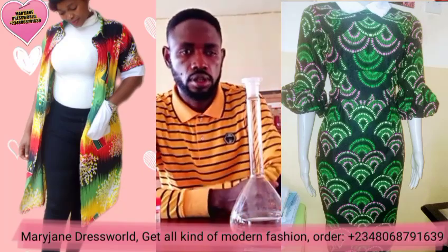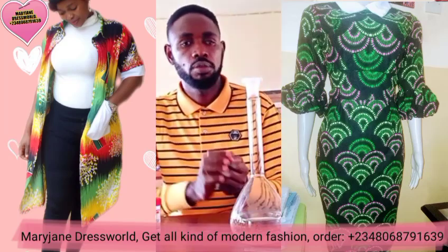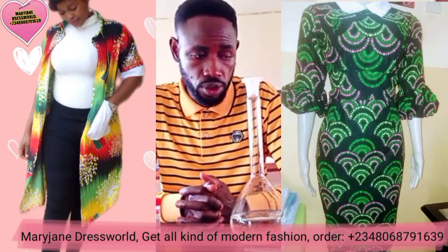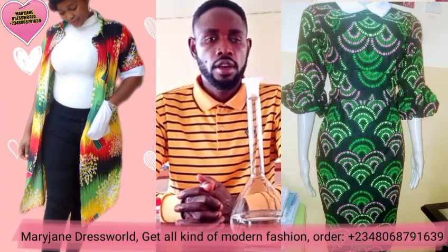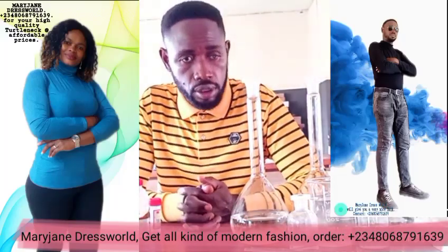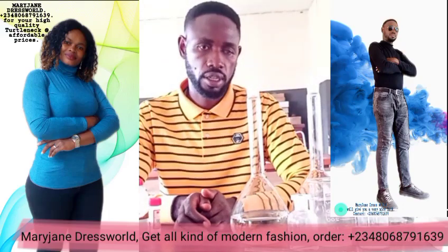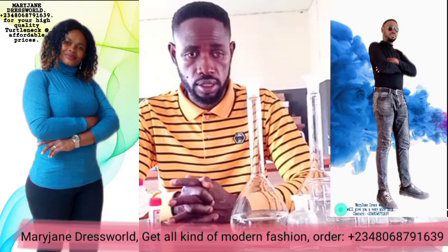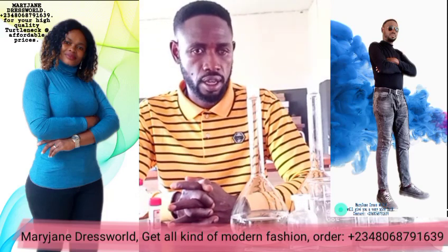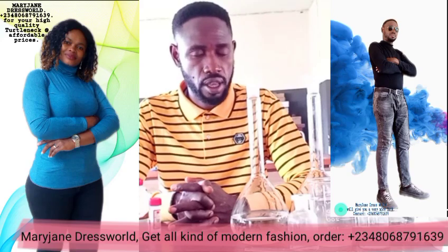Okay, these are the specifications, and this video is strictly for the chemistry teachers, to guide them on how to prepare these two standard solutions according to specification. First, we have to list the materials required for this preparation. Please follow them religiously, don't skip any, because if you make a mistake in the preparation, you are failing your students indirectly, and it's not good for a good teacher to be the reason why his or her students are failing.